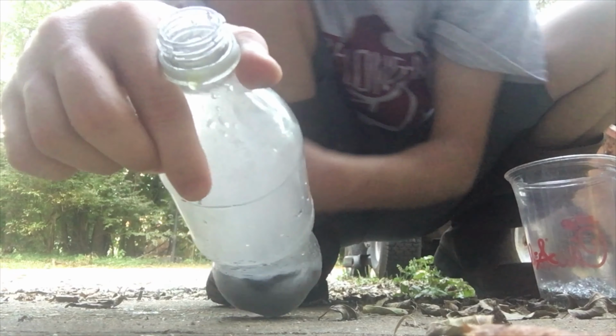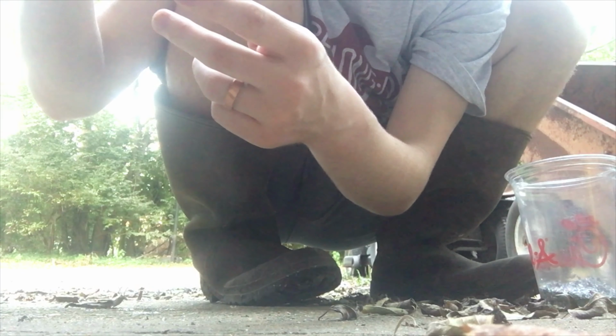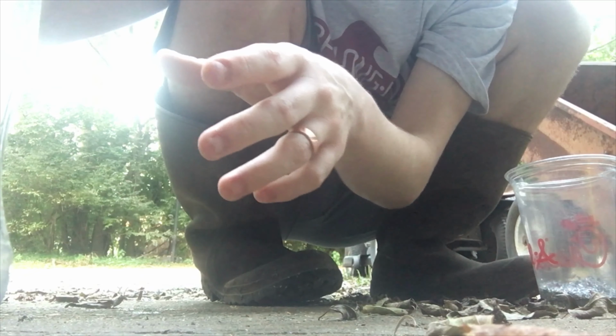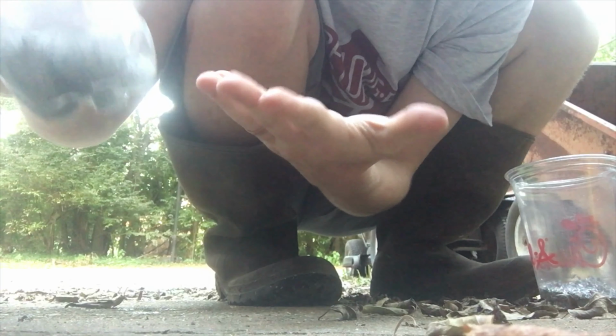And there, let me get behind it, is the gas. That's all hydrogen gas, kind of mixed in with a little bit of acid vapor, considering that this reaction is quite warm. It is exothermic, and I'm feeling it right now, and it's a bit hot. So then we got a few spills on the pavement. So yeah, we have the zinc here.